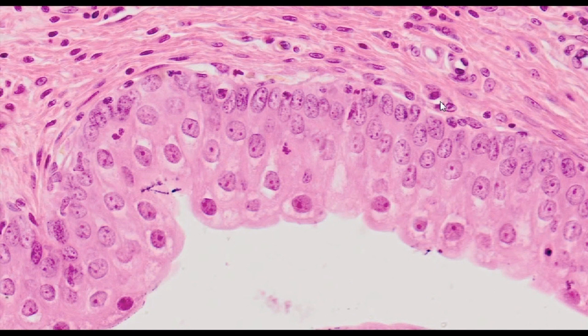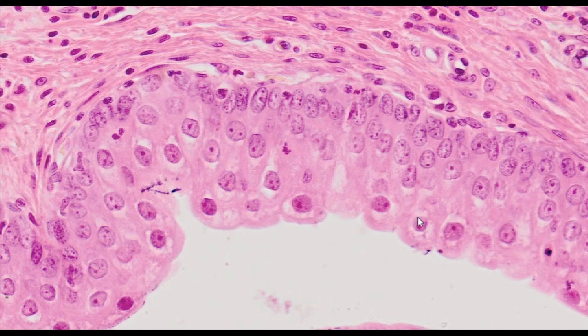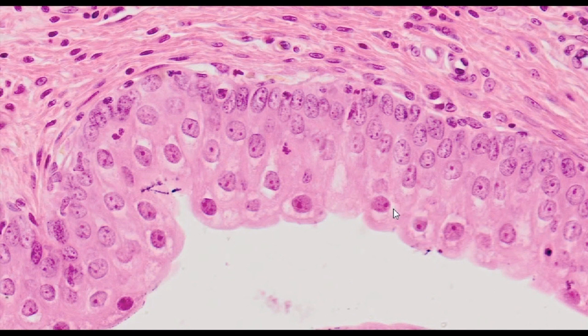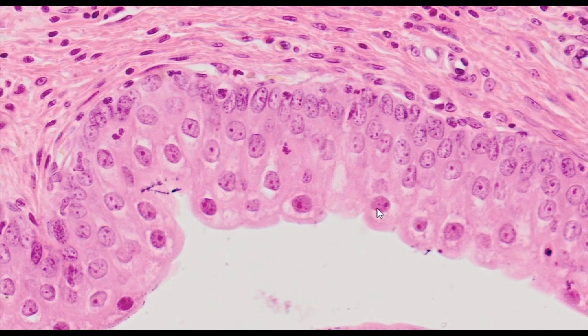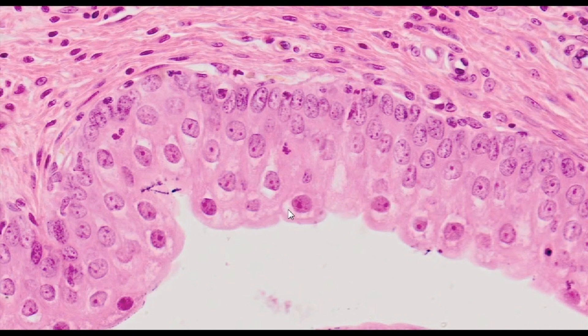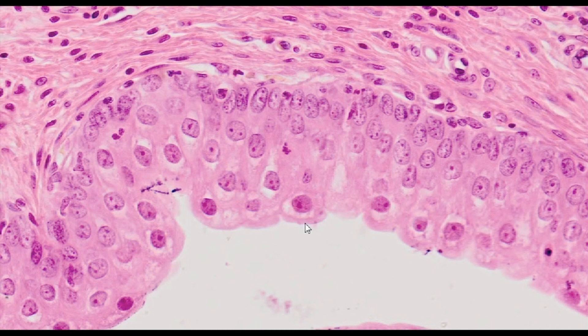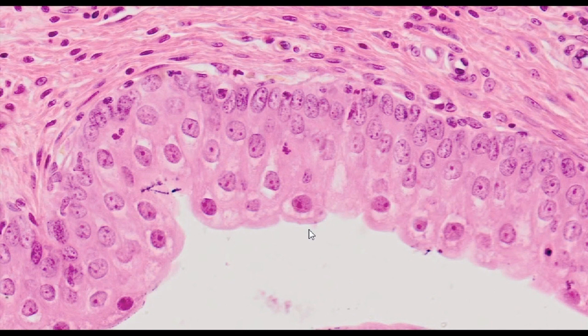The surface layer of the transitional epithelium is formed by the so-called umbrella cells, whose shape becomes flat in a distended bladder, covering even several cells of the deeper epithelial layers with a layer of cytoplasm.